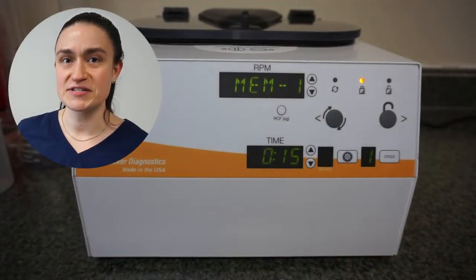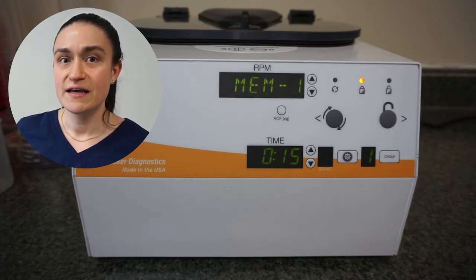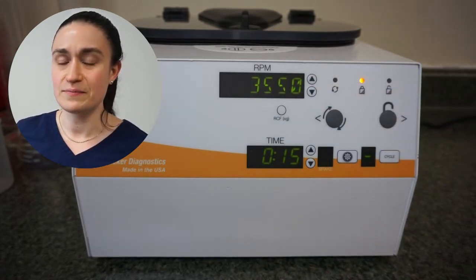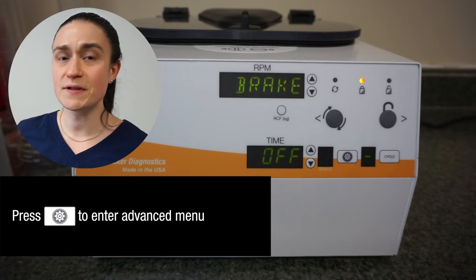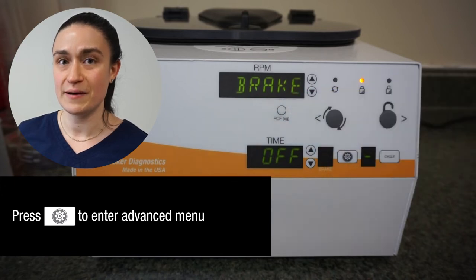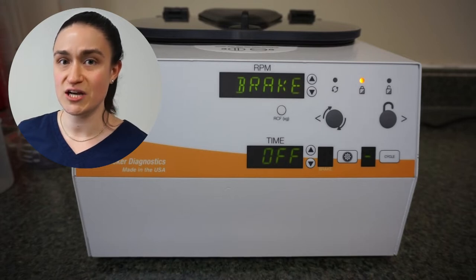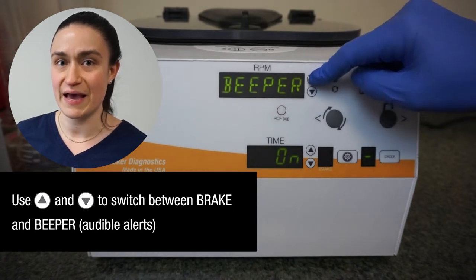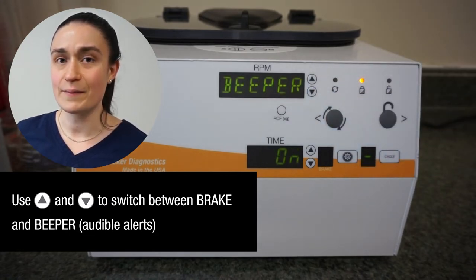To start, let's make sure our centrifuge is in free mode so we don't have a saved cycle selected. If necessary, hit the RPM up button once just to get out of any saved cycle that you might be in. Once we're in free mode, press the menu button. This will open up the advanced menu. You can tell you're in the advanced menu because "brake" will show up in the RPM window. This advanced menu gives you two different options that you can adjust. You switch back and forth between them using the up and down arrow next to the RPM. Our two options are brake and beeper.